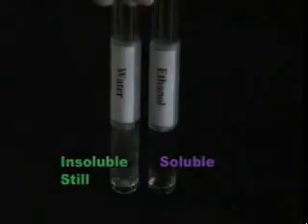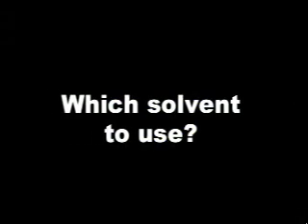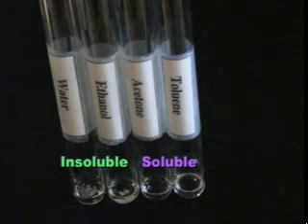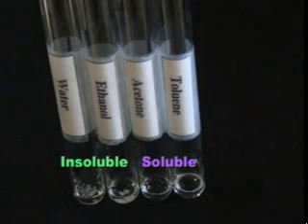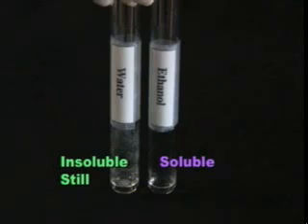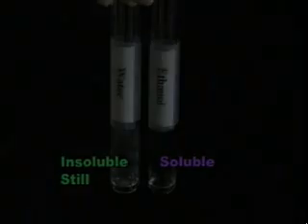Now that you have finished the solubility test, how do you decide which solvent to use for your recrystallization? The ideal solvent is one in which your compound is insoluble at room temperature, but soluble at the boiling point. Remember, at room temperature, naphthalene was soluble in both toluene and acetone, so neither of these will work. After heating, naphthalene remained insoluble in water, even at the boiling point. This means that ethanol is the solvent of choice — it dissolves the sample at its boiling point, but not at room temperature.